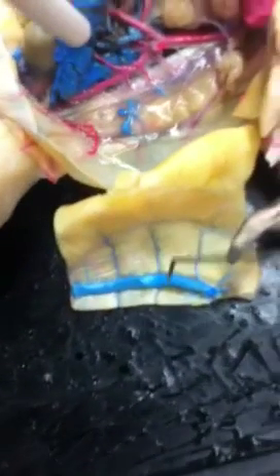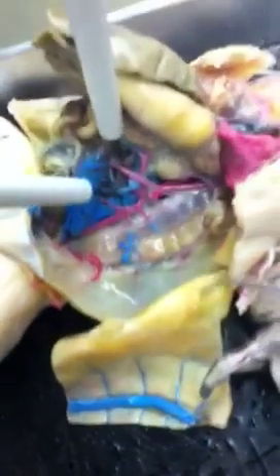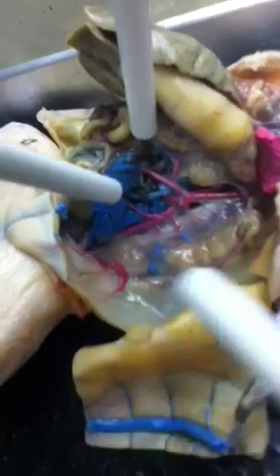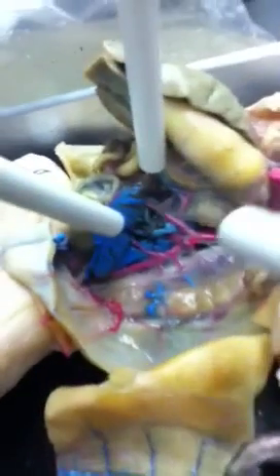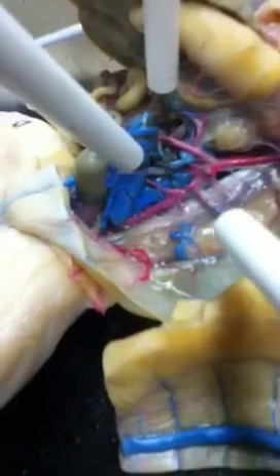Now while we're here, I'll go over some of the veins. This vein is going to be the abdominal vein, and the other areas it comes out from are the liver and down underneath here.